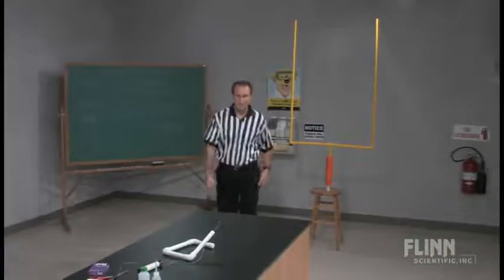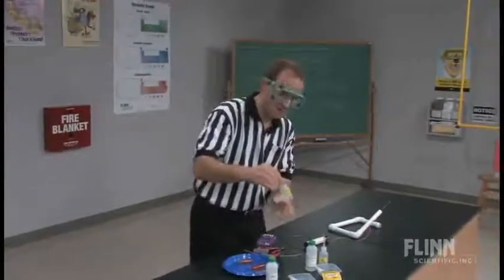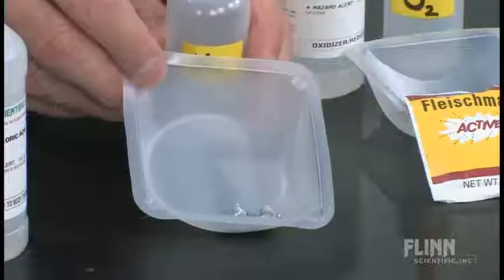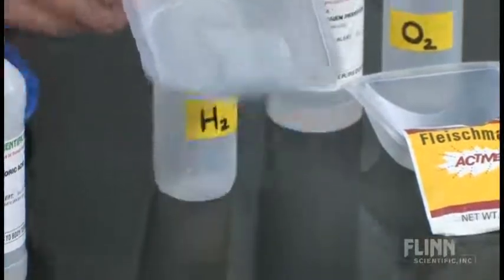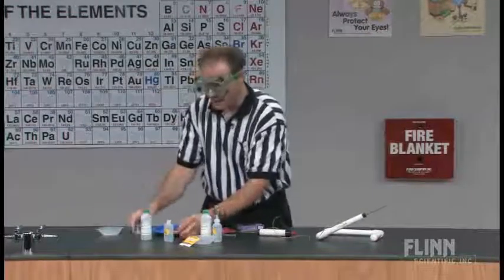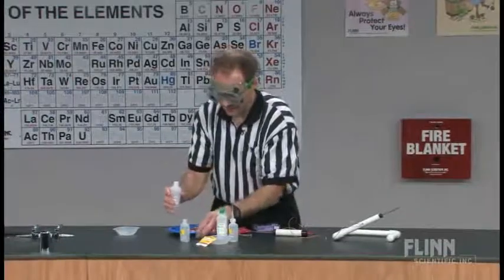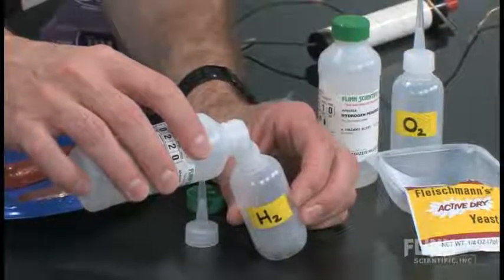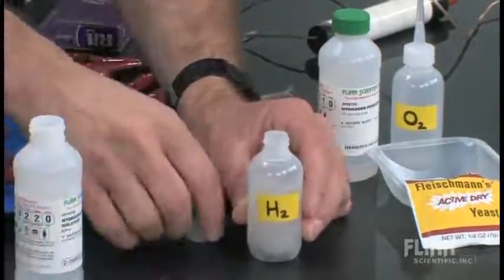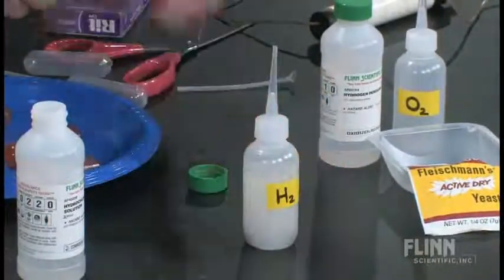For the actual experiment, inexpensive chemicals. For our hydrogen generator, we're going to take some pieces of mossy zinc — three or four works fine — and put that inside the container. I'm going to add some two molar hydrochloric acid so that we'll produce some hydrogen gas. You'll notice that I'm filling about three quarters of the way up. I do that so that we minimize the amount of residual air space that's present. We're going to let that start its reaction.